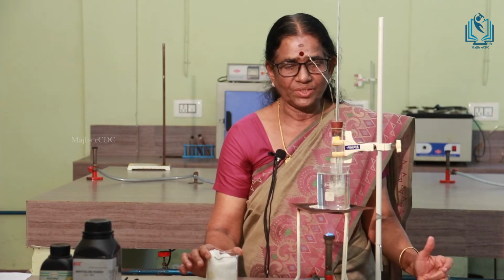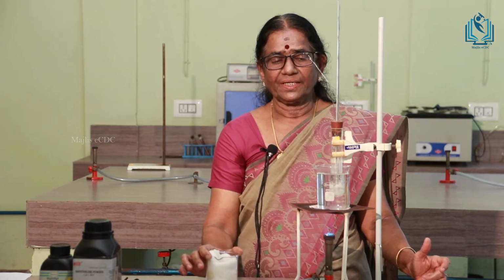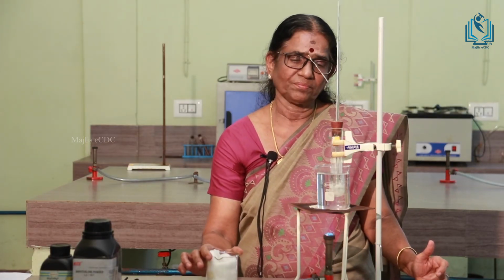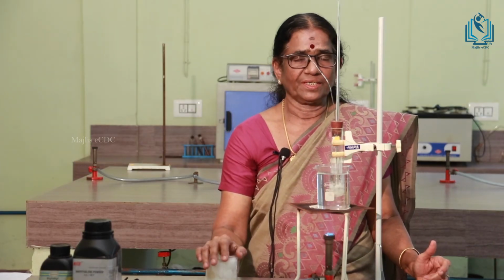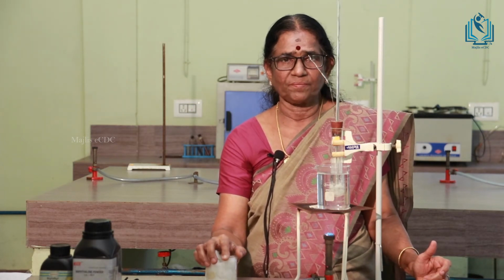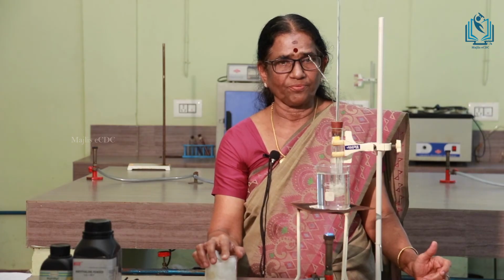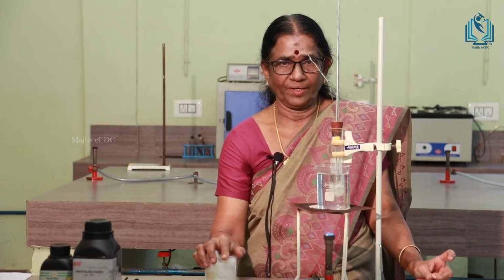Then from the two temperatures you can determine the depression in freezing point. Then again you have to do a duplicate by adding 0.25 gram biphenyl again to this mixture, heat it and determine the freezing point. So 2 times you will be getting the delta TF values, one with solute 0.25 gram, and the second case the weight of the solute will be 0.5 gram, because you have added 2 times 0.25 gram. So the total solid in the second case will be 0.5 gram.